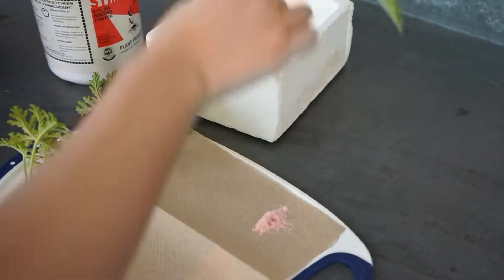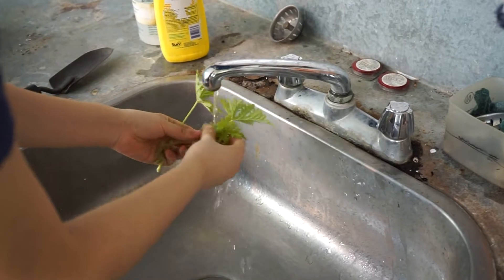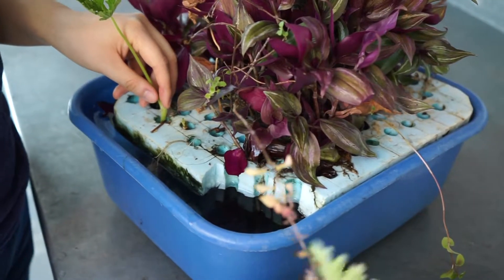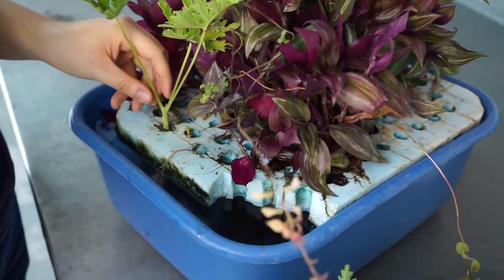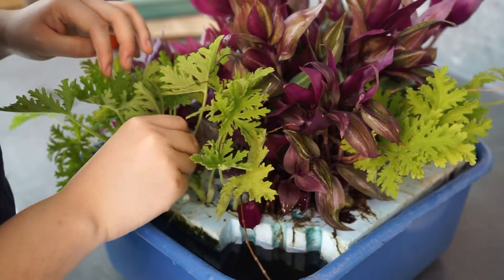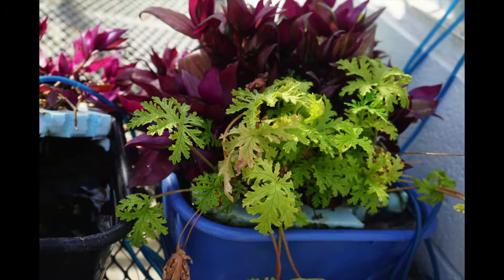For the comparison group with hormone treatment, the stem was dipped into hormone and left on the bench for 1 hour. After 1 hour, rinse off the residual hormone to avoid influencing the control group, which was not treated with hormone. Place 2–3 cuttings in one hole so that they can be fixed in place. Connect the hydroponic system back to the air pump, and then observe the result after 6 weeks.